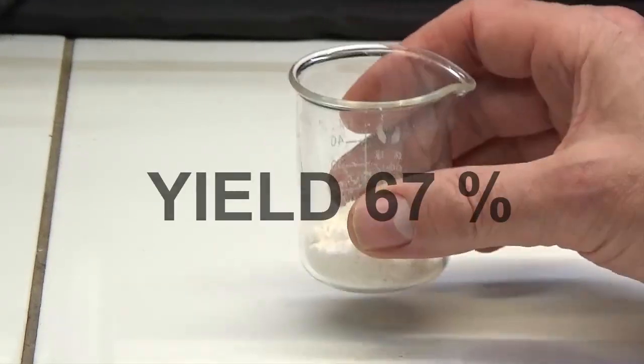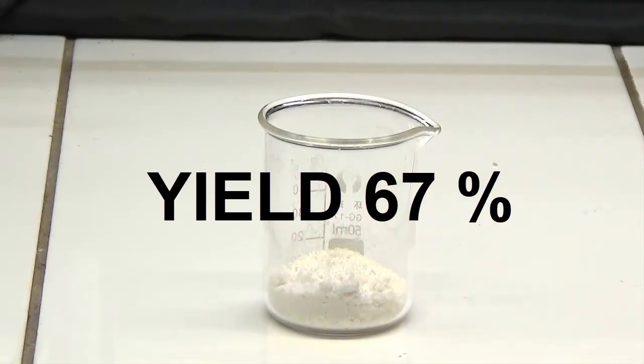In this operation, 2.4 grams of white powder was obtained with a yield of 67%.